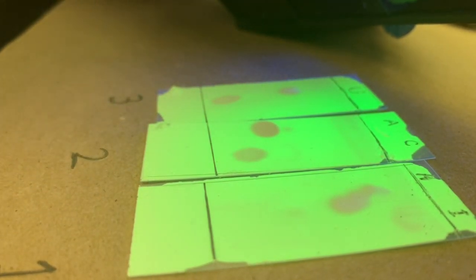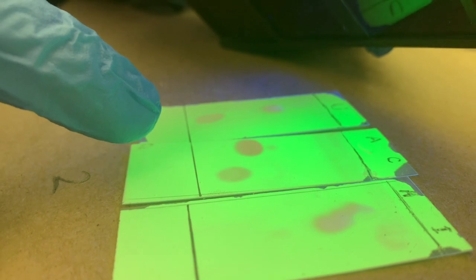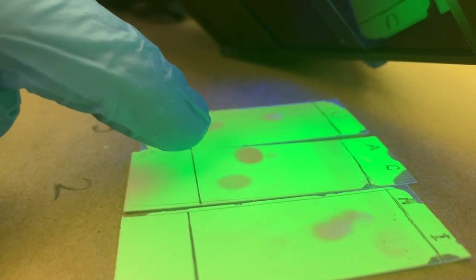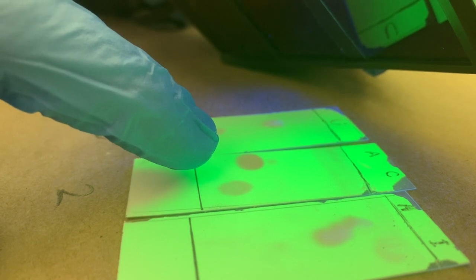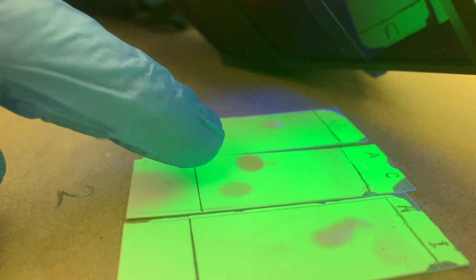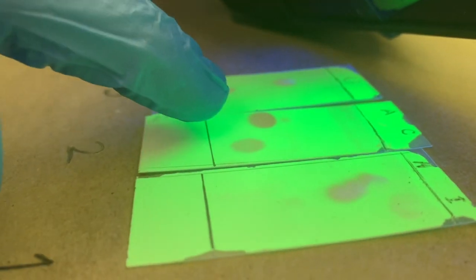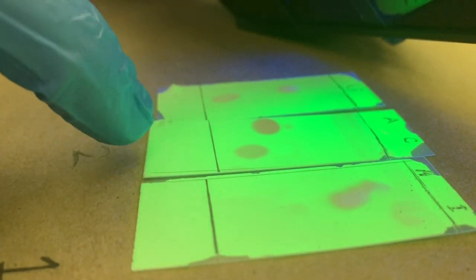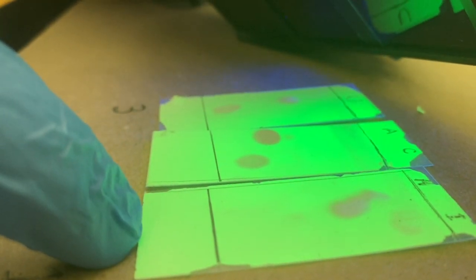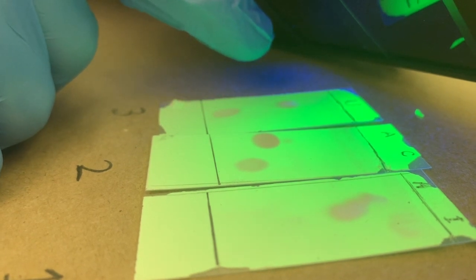We'll use the RF to help calculate and justify that idea. The other sample, in this case acetaminophen, is a little bit further than the caffeine and has a darker appearance because it's absorbing more of the UV light. So since it's a little bit further from the starting point, you're probably not going to assume that this other spot in the unknown comes from that acetaminophen.